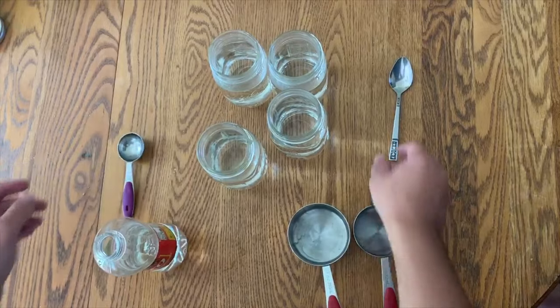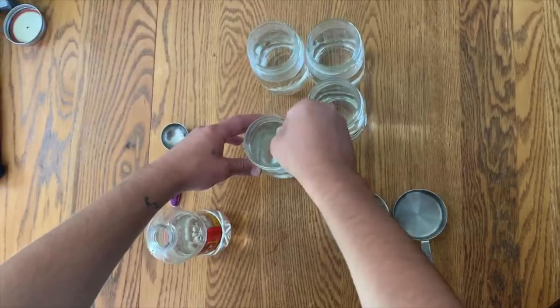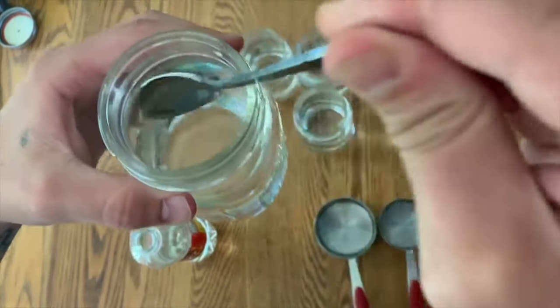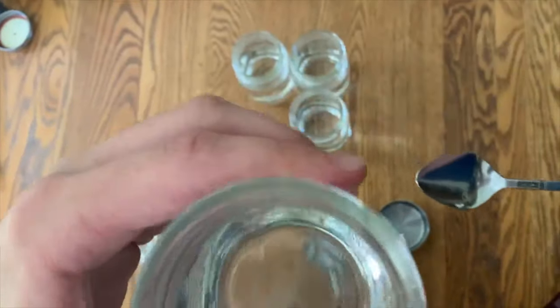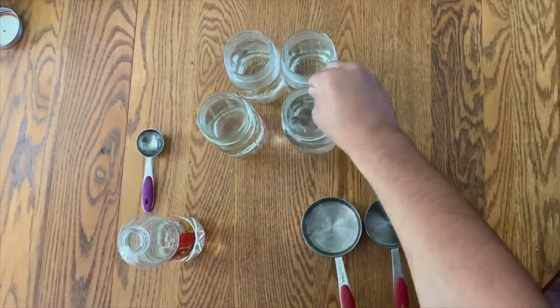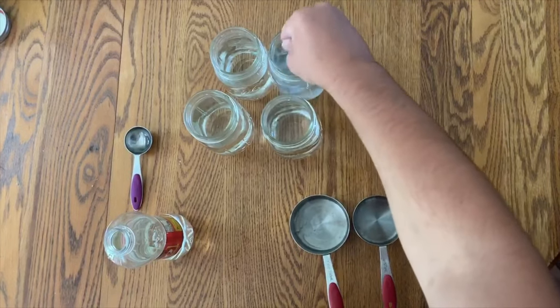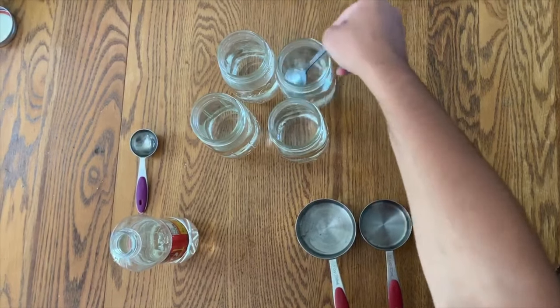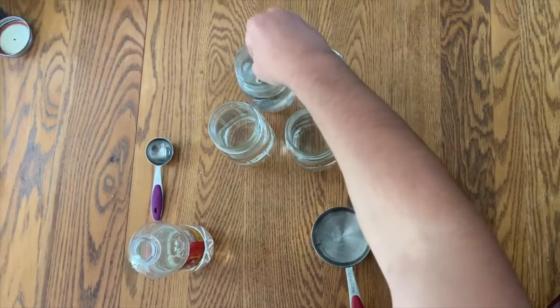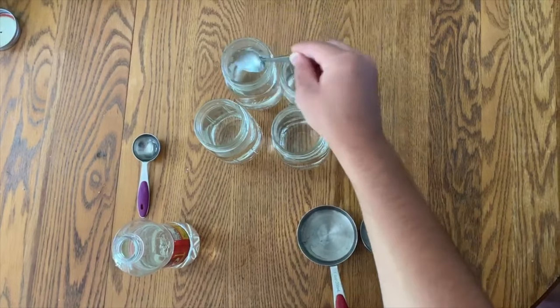You can use a syringe to get it exact if you need to. Mycelium doesn't like higher than 4% sugars and thrives off 3% even, but 4% is pretty much dead on. Now that you have the correct measurement of warm water and Karo corn syrup added to the jars, grab a spoon and stir it to help dissolve the syrup into the water.